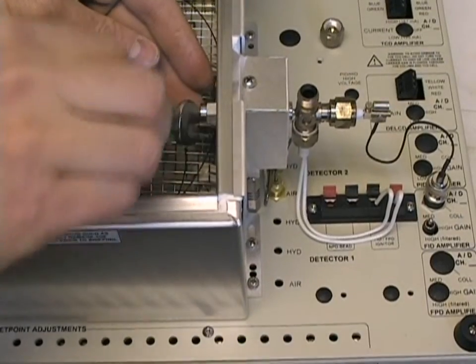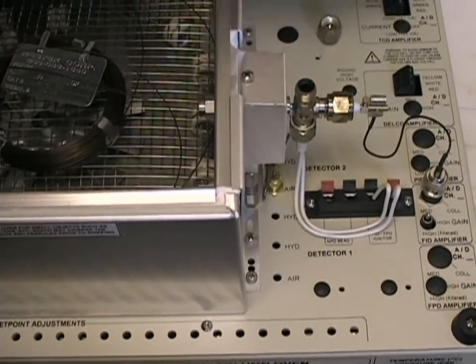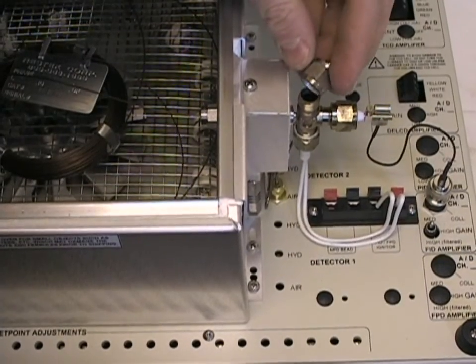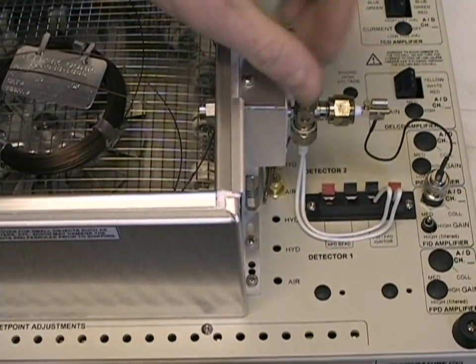Be sure to replace the nut over the FID vent so that you can get proper ignition of the flame when we fire up the GC.